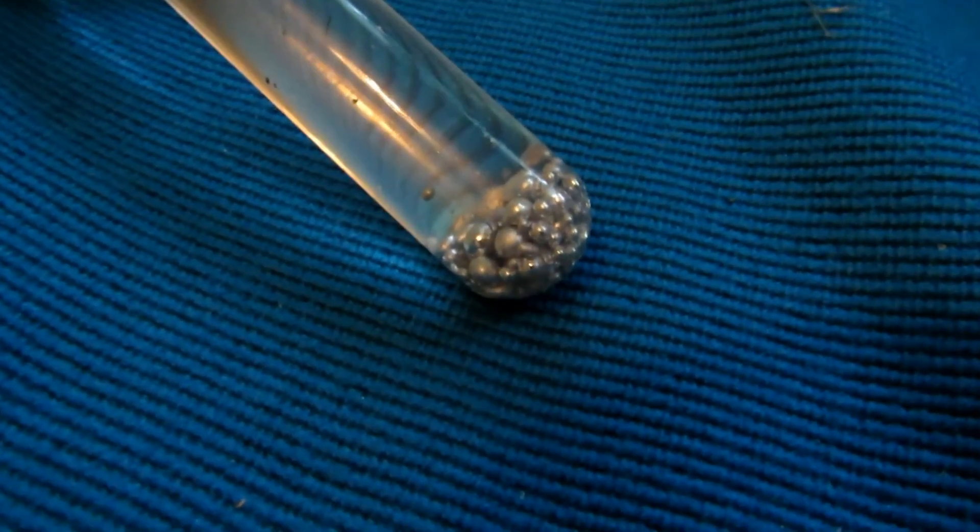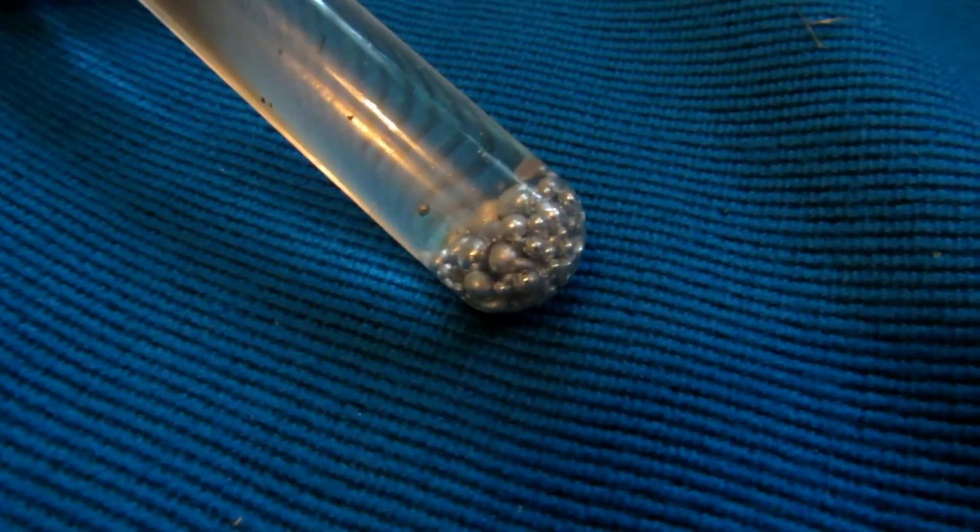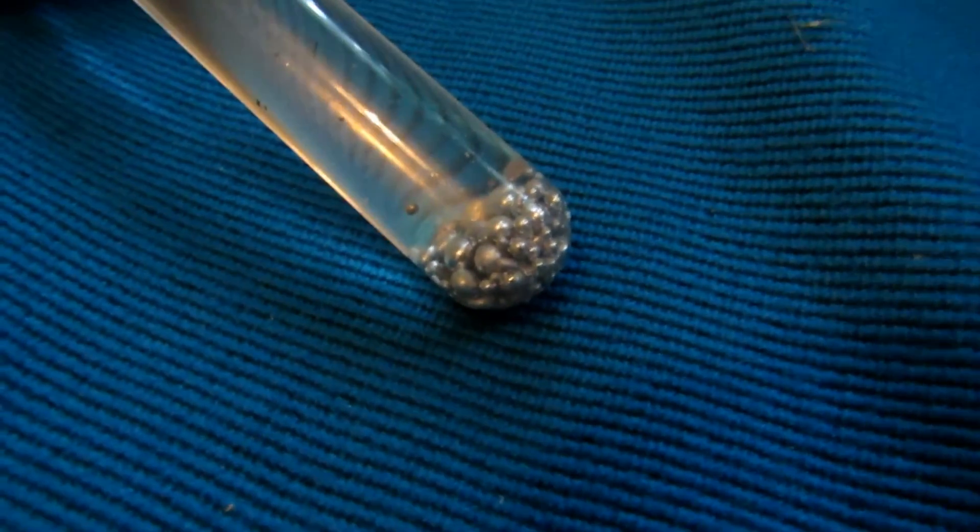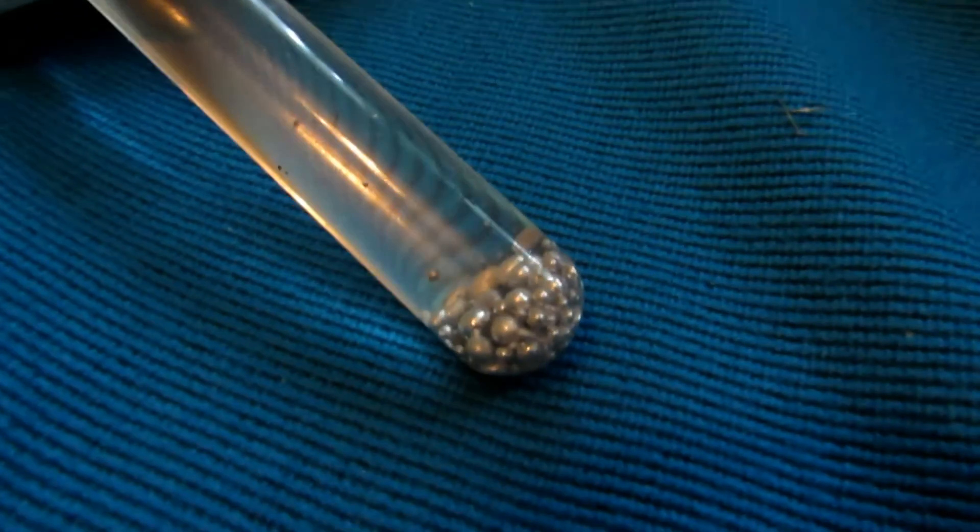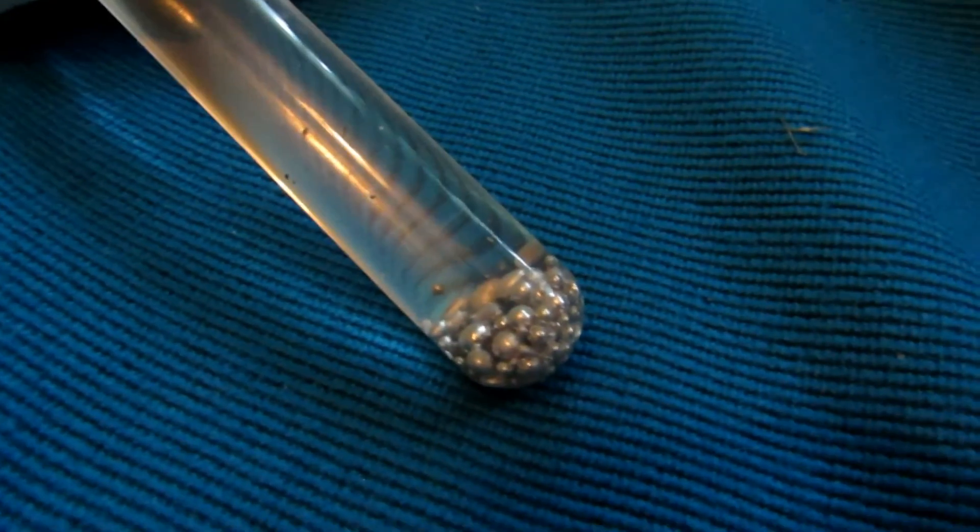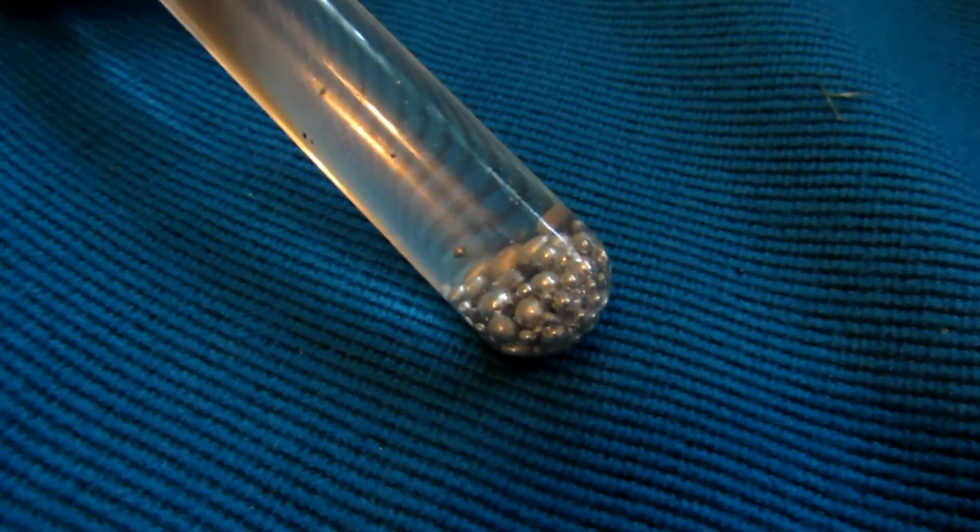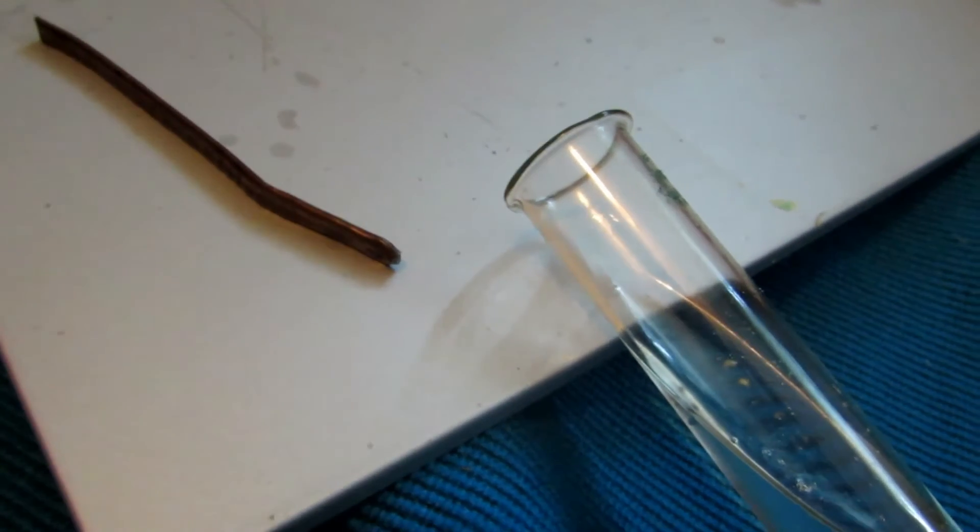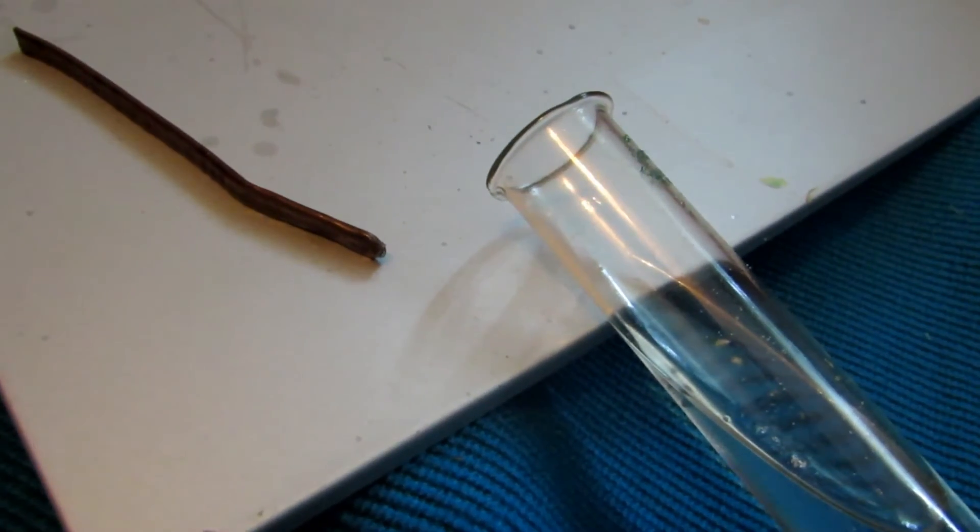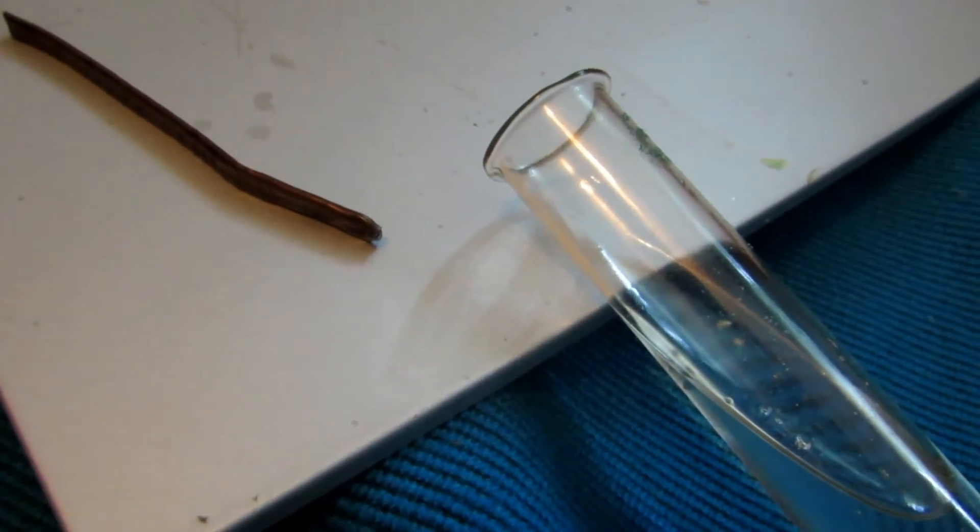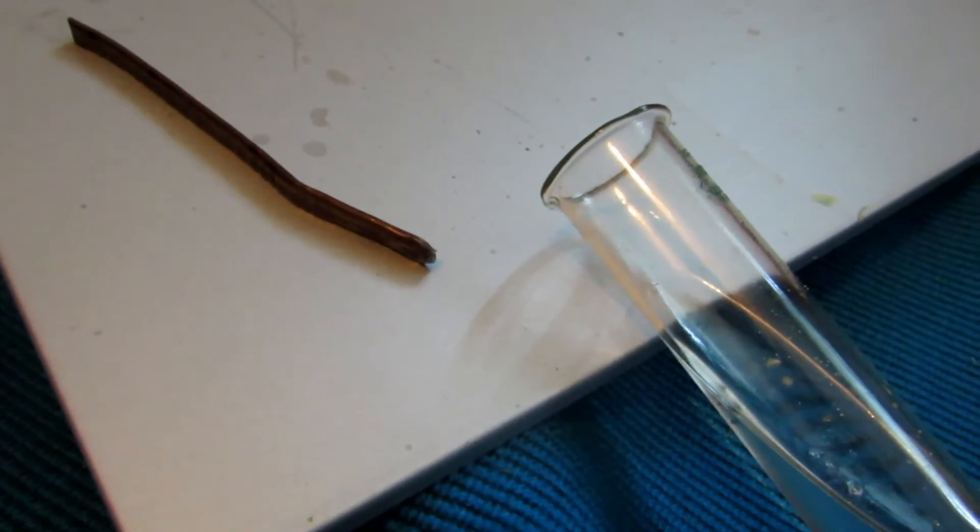Okay, so there's our final yield of sodium and potassium alloy, and you can see it's a fair bit. Now, so if you have an old oven, definitely try to get that weird thing out of it. I think it might have been a thermometer or something, because it's very useful. Now even though we already used all these pieces here, they still contain a bit of sodium and potassium alloy inside them. And they are pretty cool to play with. So if you just chop them in half and then dip them in water, you should get a pretty cool reaction. So save those.